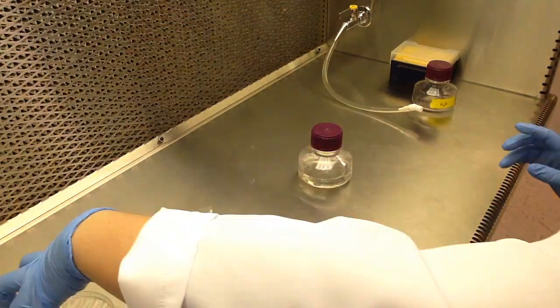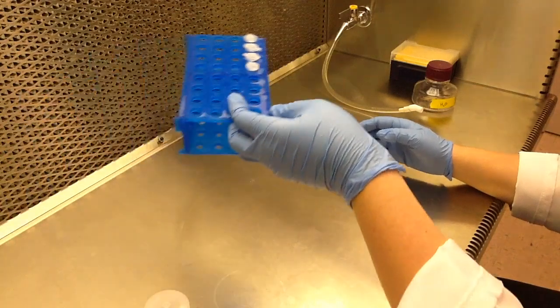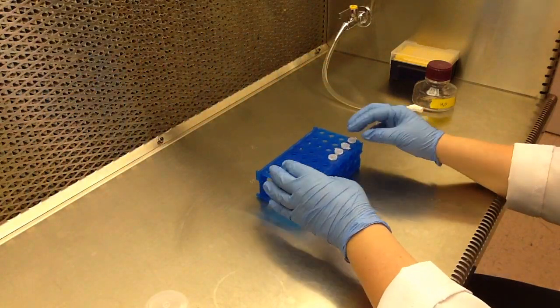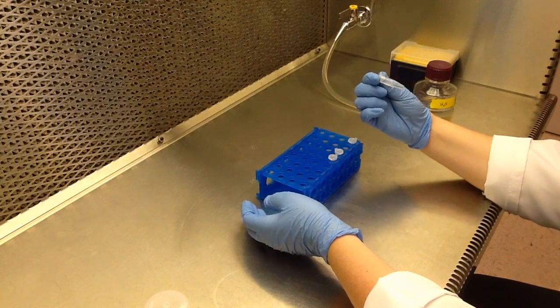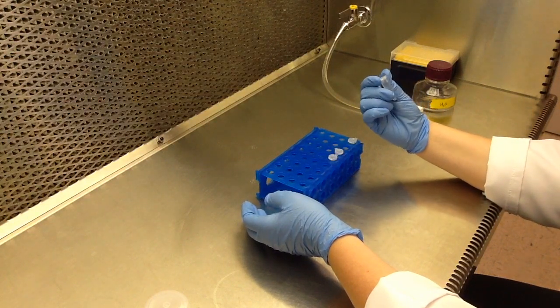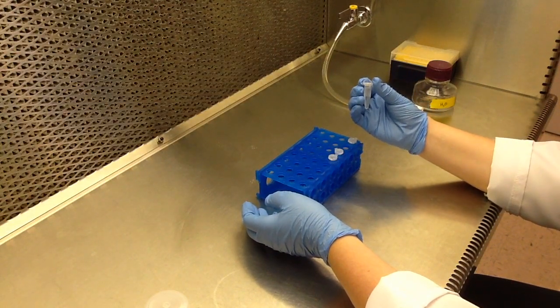Tightly seal the solution bottle and label as necessary. Again, it's a good idea to aliquot your stock solutions to minimize the risk of contamination and limit the amount of freeze-thaw cycles that your reagents go through. Store your solution at negative 20 degrees Celsius.